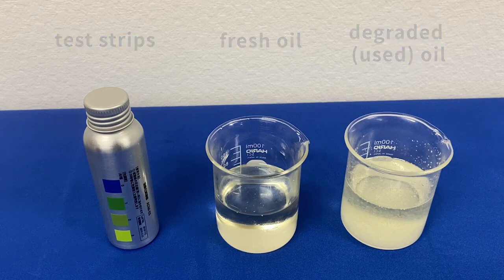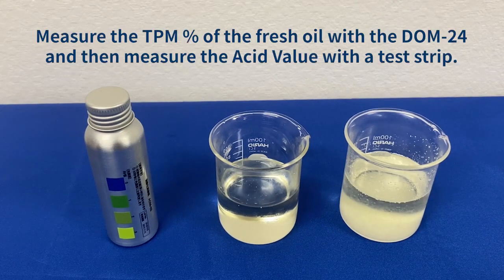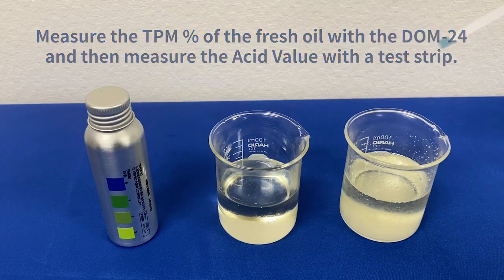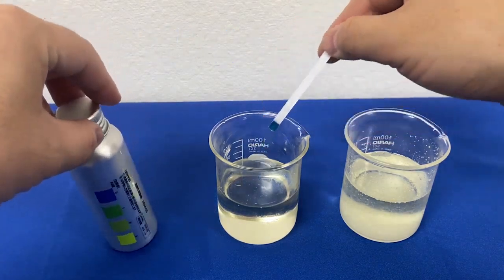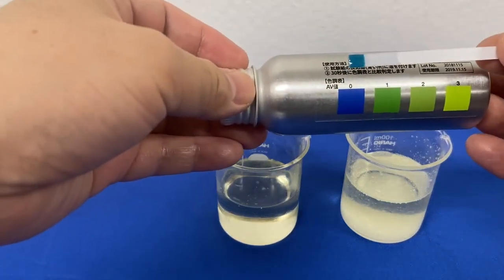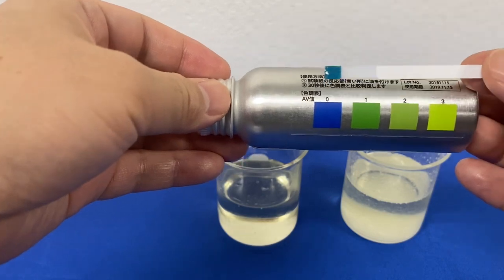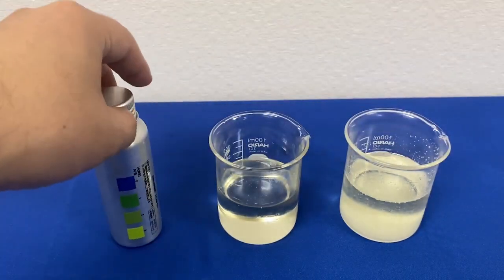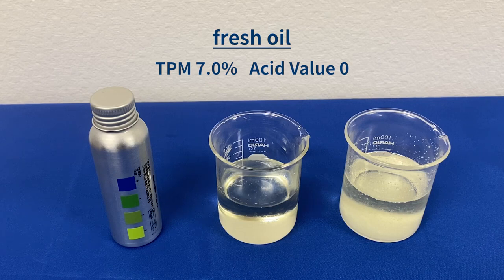Measure the TPM percent of the fresh oil with the DOM24 and then measure the acid value with the test strip. The color changes when the test strip is dipped into the oil. The acid value is zero when compared to the color chart. In this example, the fresh oil is 7% TPM and the acid value is zero.